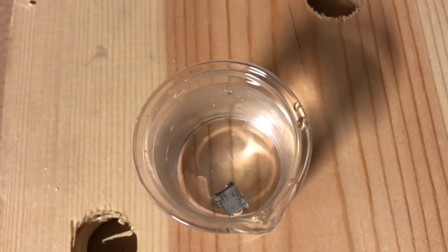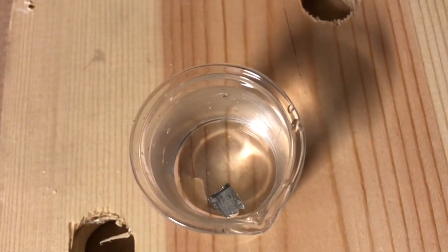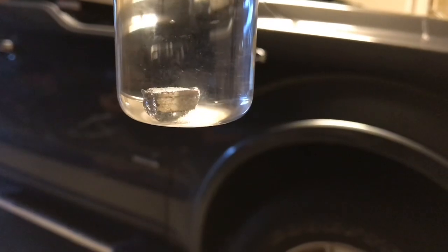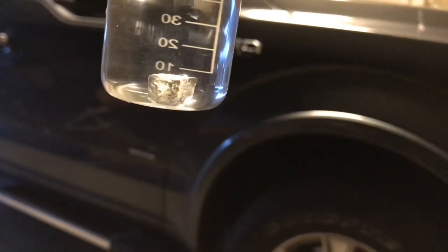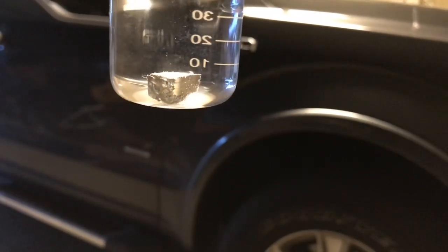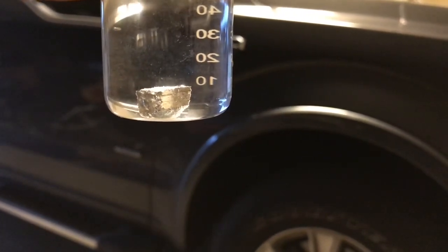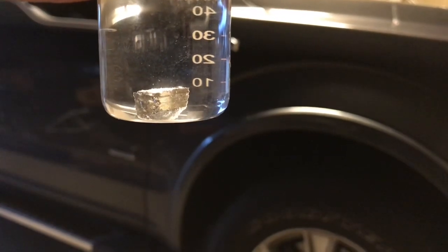Doesn't look like a whole lot is happening. We'll give it a couple of minutes and come back. It seems like it's activated a little bit. You can see some bubbles of hydrogen beading up on the metal, but nowhere near as much as aluminum. You can see some little bubbles of hydrogen rising off of it.